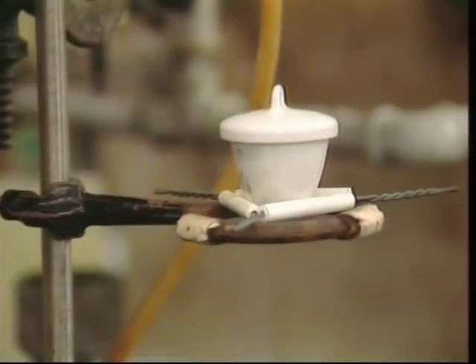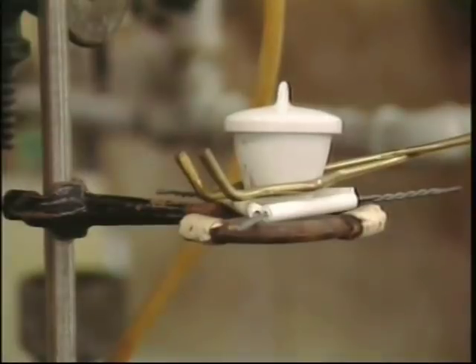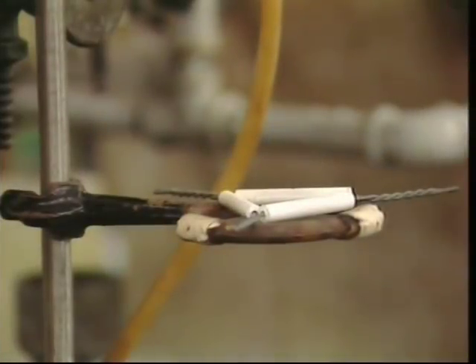Besides glassware, the most common cause of burns is touching a hot ring stand. There is nothing in the physical appearance of a ring stand that tells you it's hot. However, remember that metal will retain heat for quite some time. So if you've been using a ring stand with a heat source, assume it is still hot and handle it very carefully.